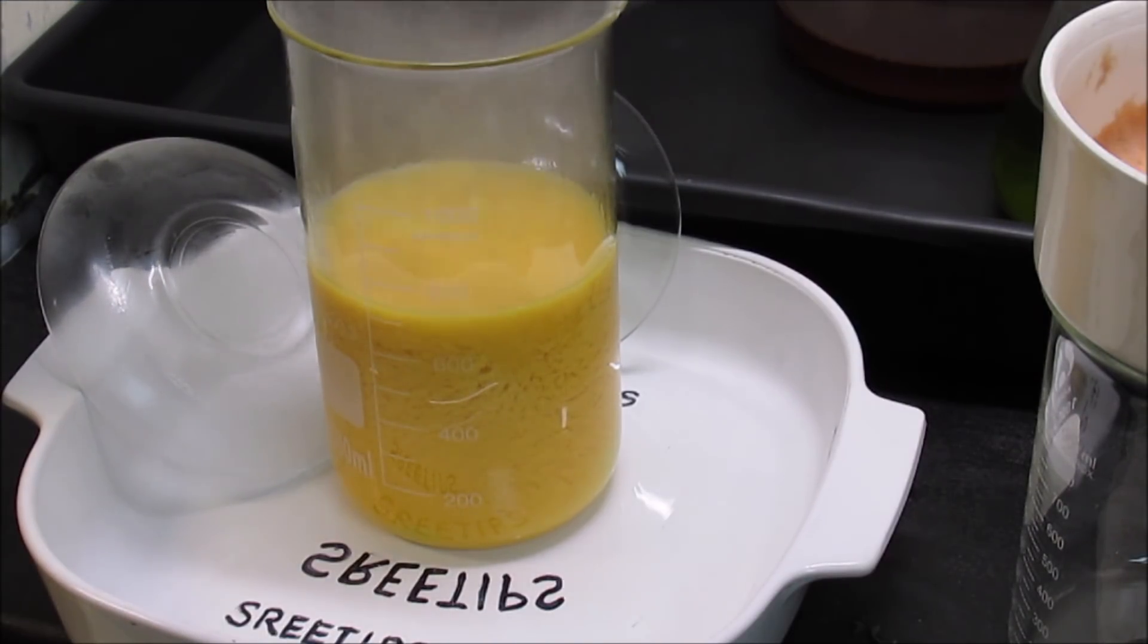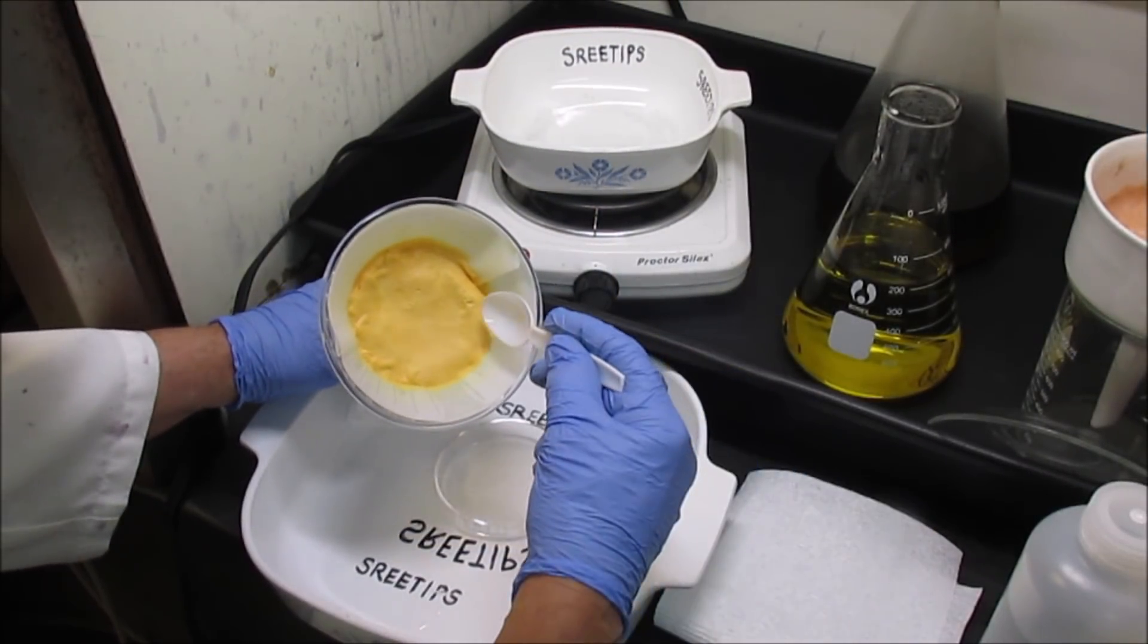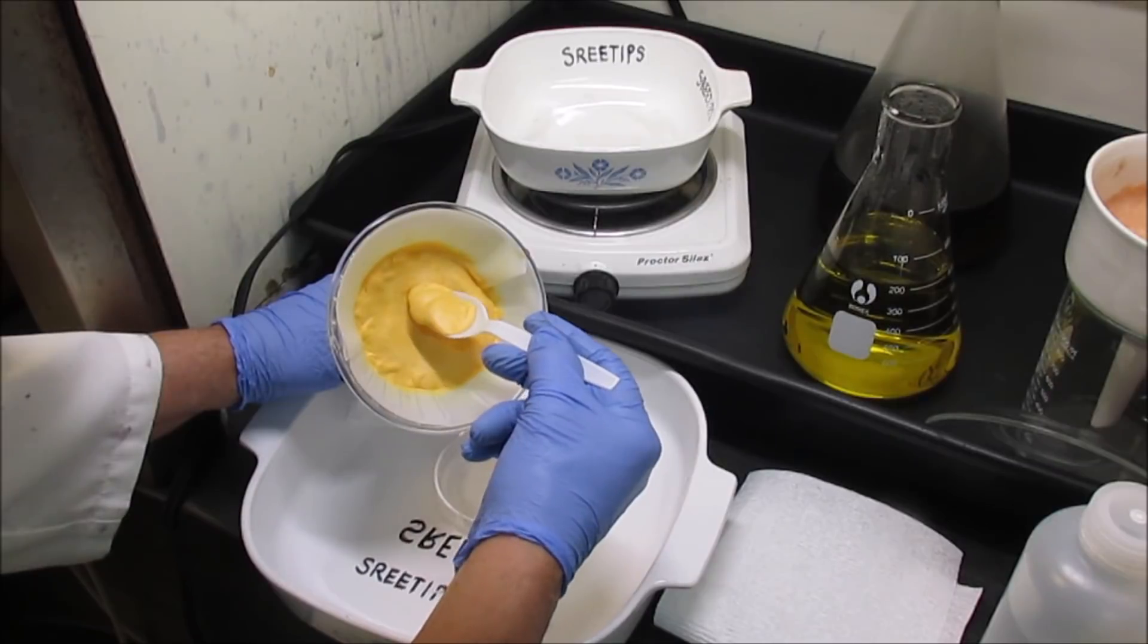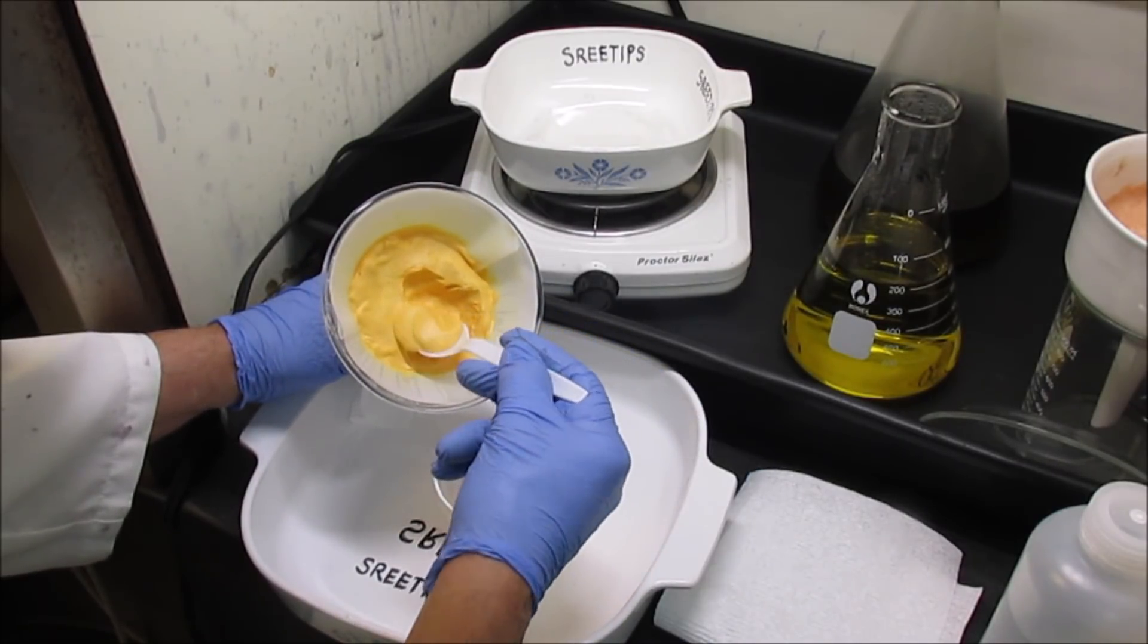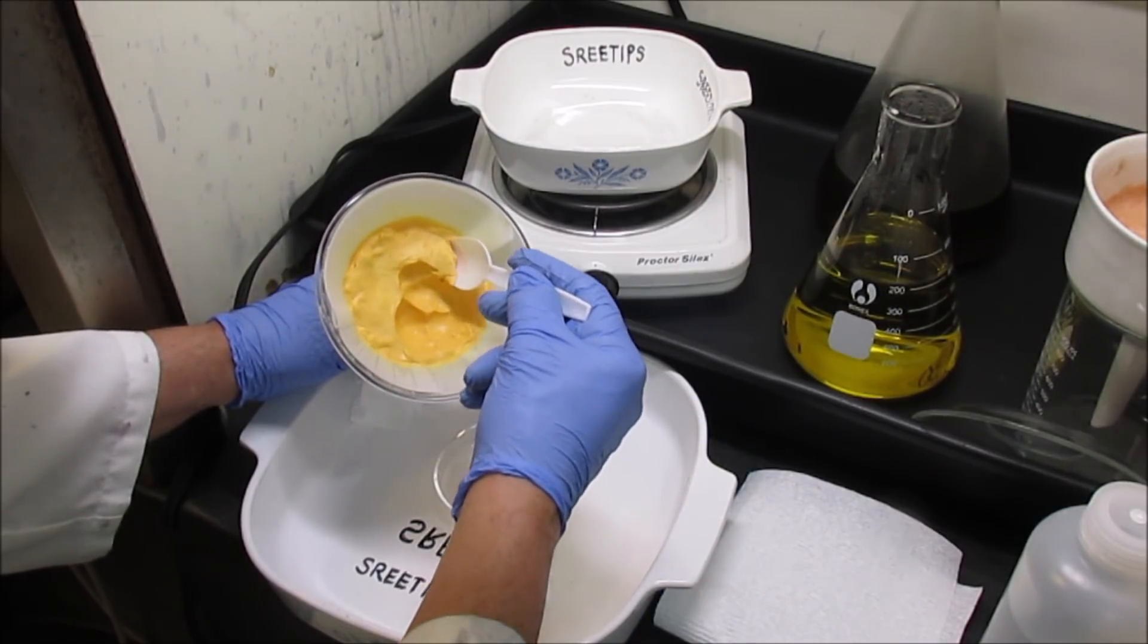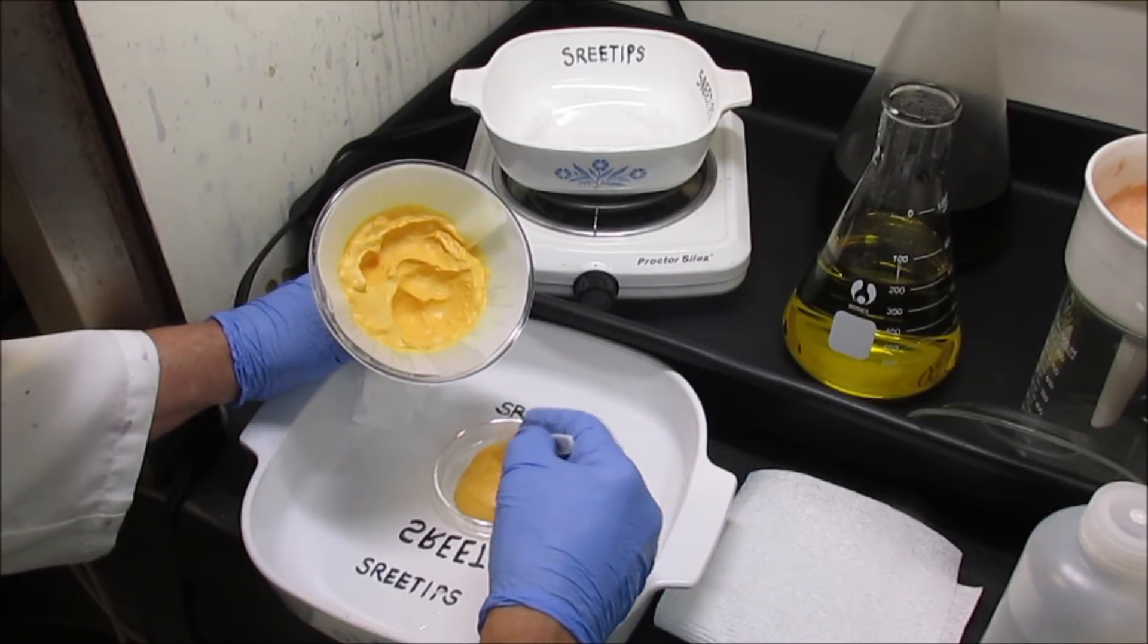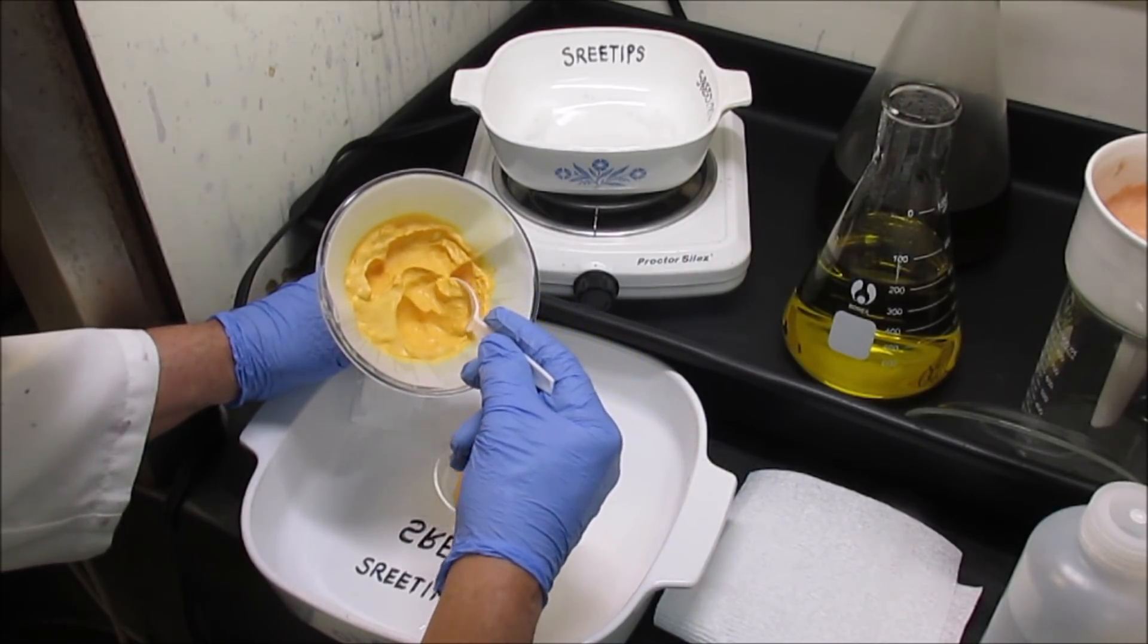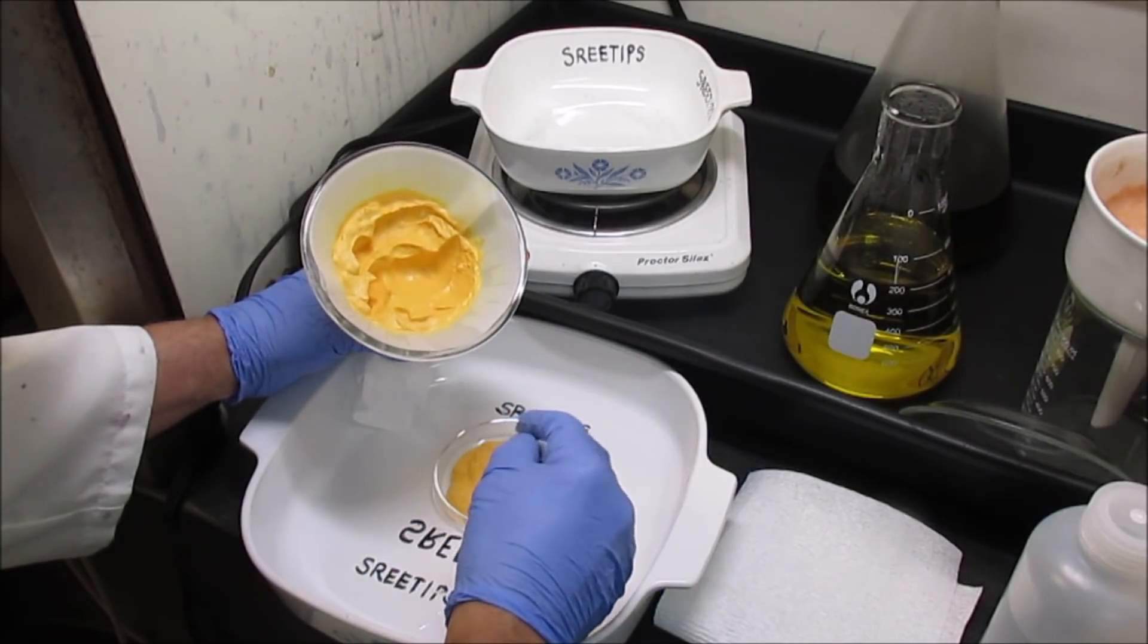Alright, that was just the right amount of hydrochloric acid to add. Get some out with a spoon here and put it down into the dish. Scoops out like soft ice cream.